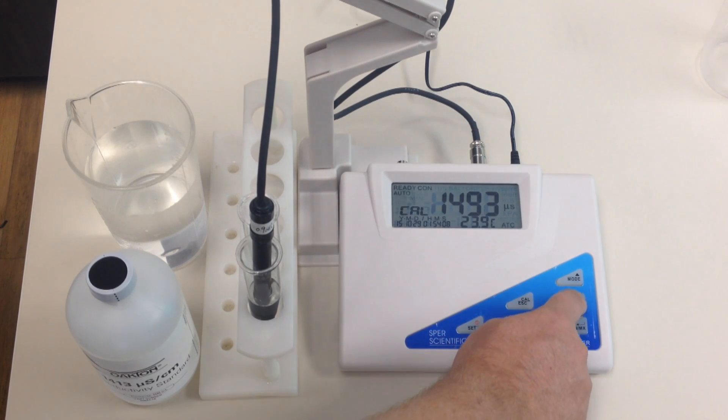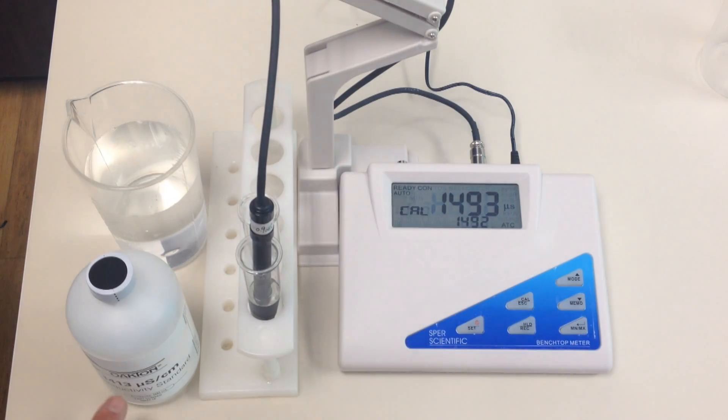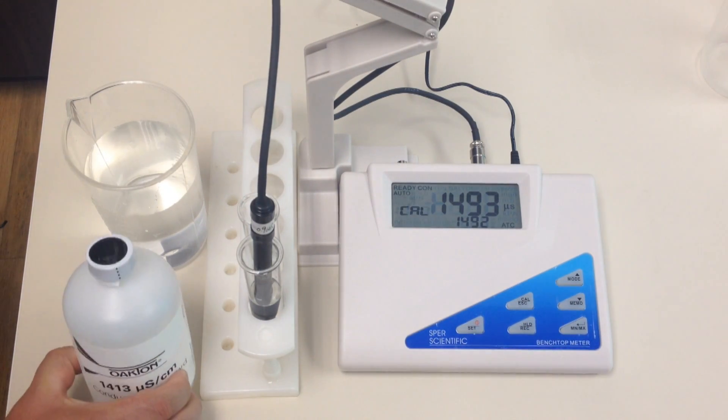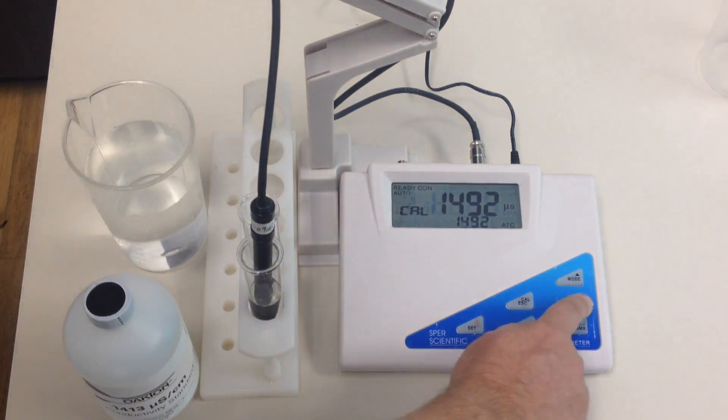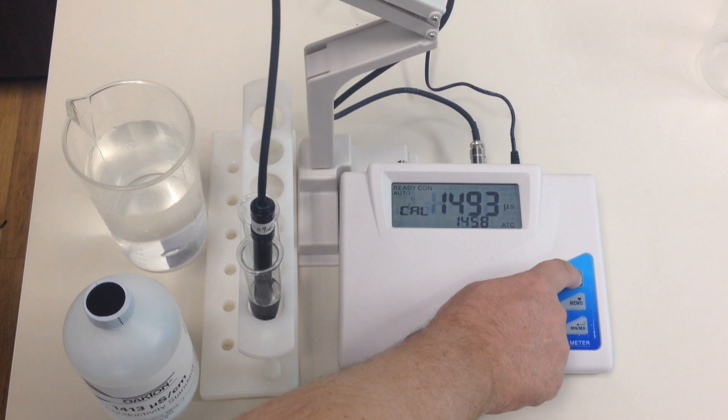And then we're going to go up and down until we get to 1413, because that is what our test sample is, our calibration solution. So I'm going to go down, but if I wanted to go up, I would use the up button, but I need to go down.